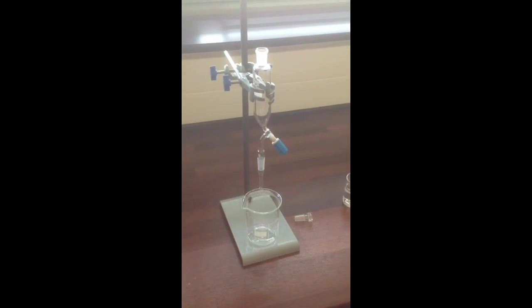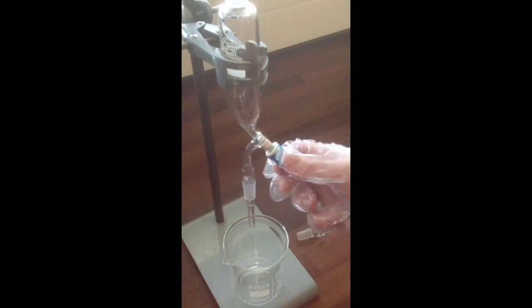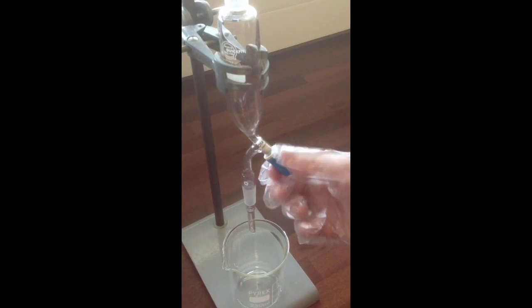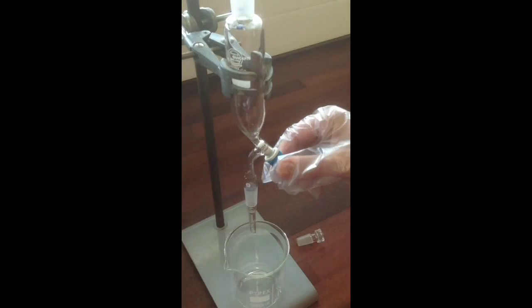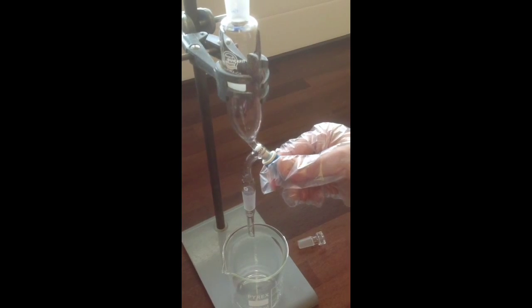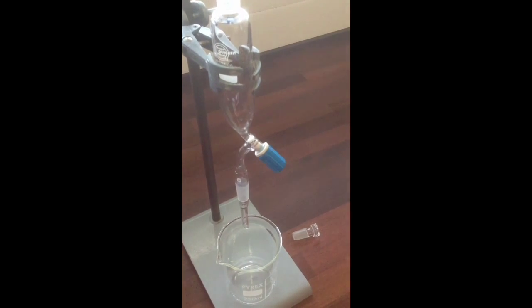With these separating funnels, before you put any liquid in, the key thing is to make sure the tap is closed. And most of the separating funnels have a screw-in tap, which you wind in until the white plastic cylinder is pushed up, blocking the hole at the bottom of the separating funnel. Don't turn it too tight, but turn it so that it's a snug fit.